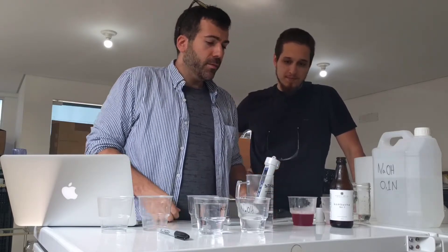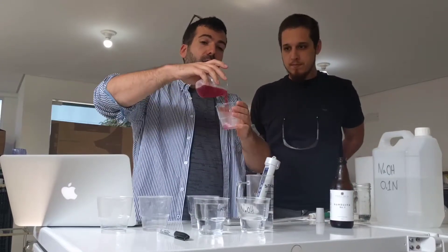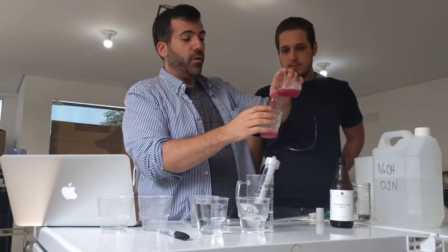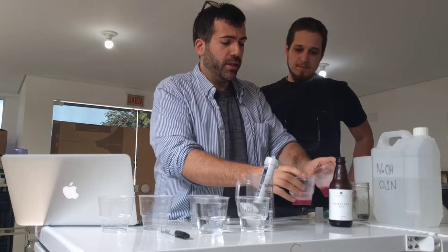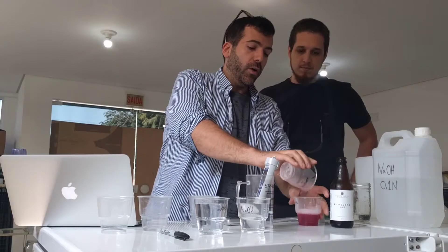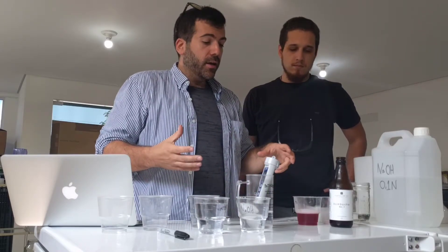So what do you need? First of all we need some kombucha — that's what we're gonna be titrating. I've degassed it. To degas it you're just pouring it back and forth a dozen times or so, and if there's barely any bubbles left then you've degassed it. Why are we degassing it? Because CO2 is an acid. We're doing a titration to determine how many grams of acid are in our product, and we need to take out the CO2 so that we're not titrating that.